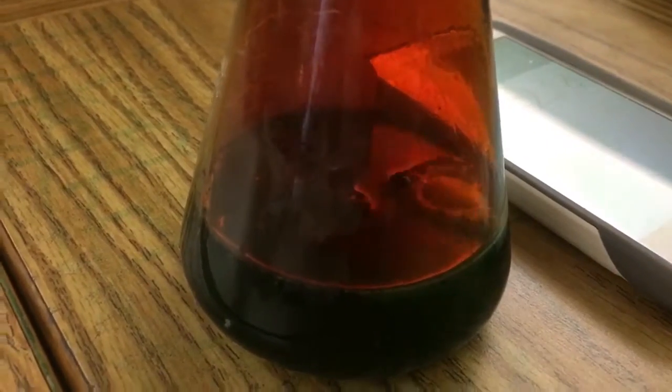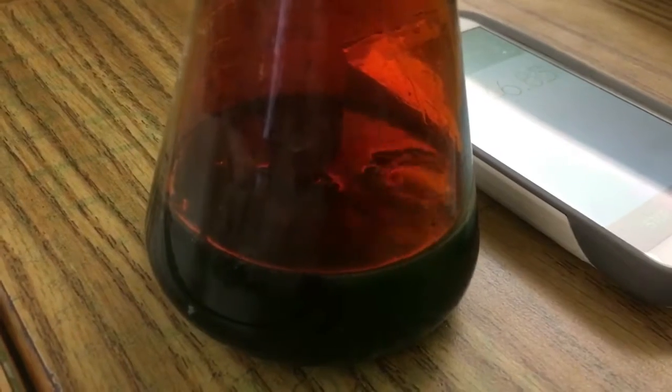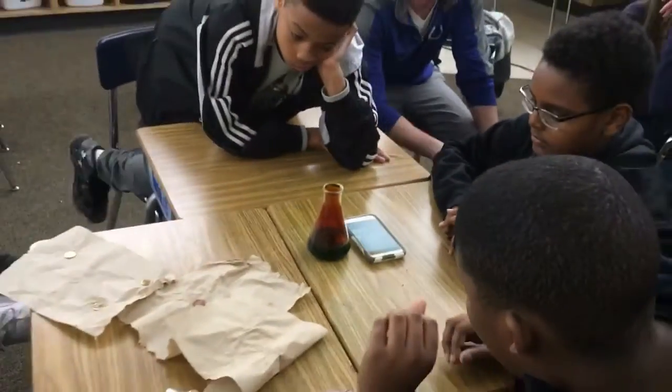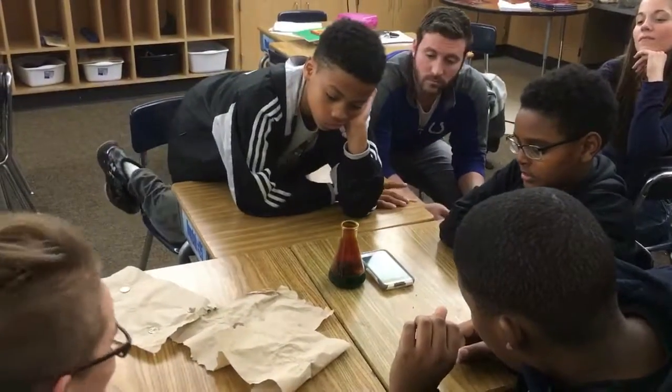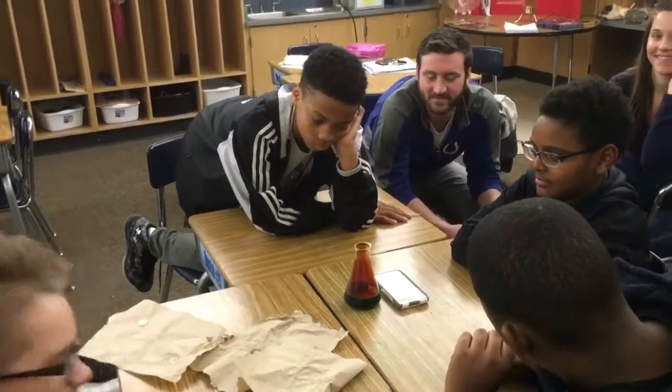Let's zoom in on that penny again. It's still floating. Now we know pennies aren't supposed to float. It's decomposing. It's getting so small, it's almost the size of a pea. Look at that. It's almost gone. Don't sniff that up. Decomposing pennies in RamZland. How cool is that?